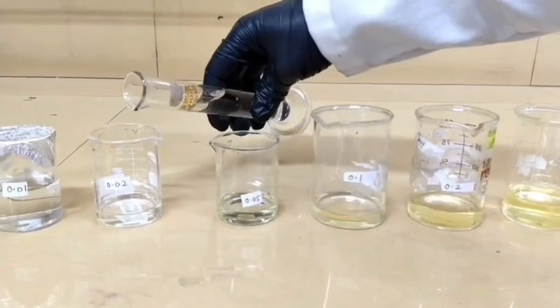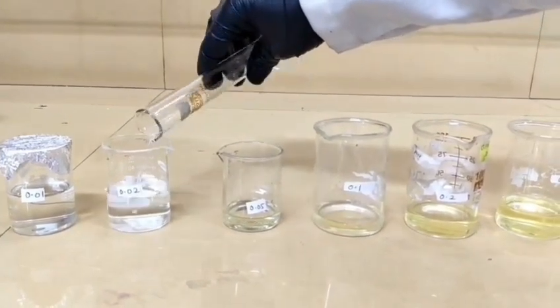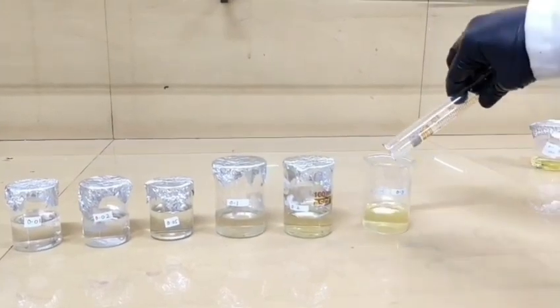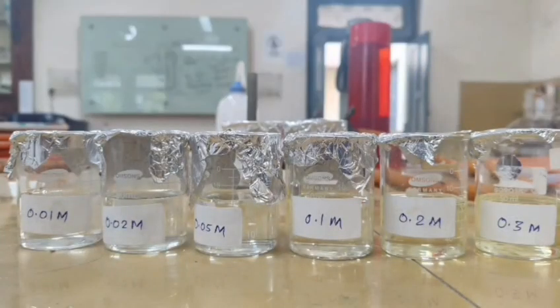So one by one I have to prepare all of these concentrations. Now after making up with double distilled water, our solutions are now prepared.